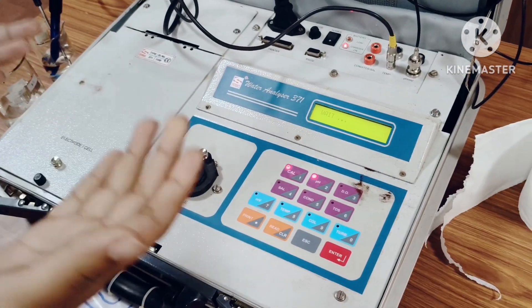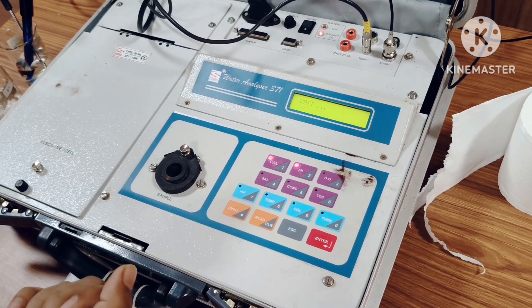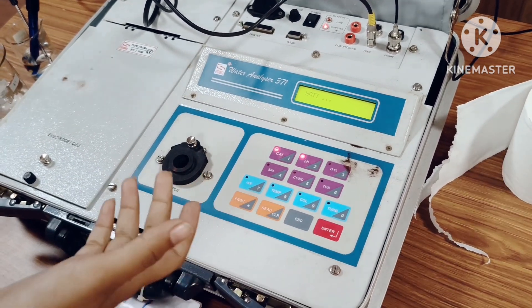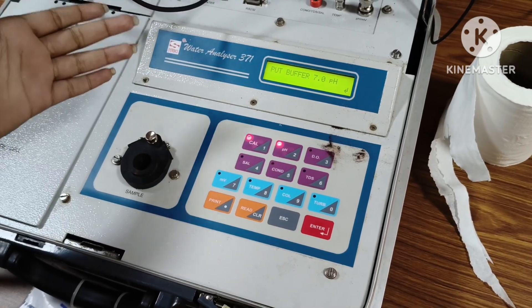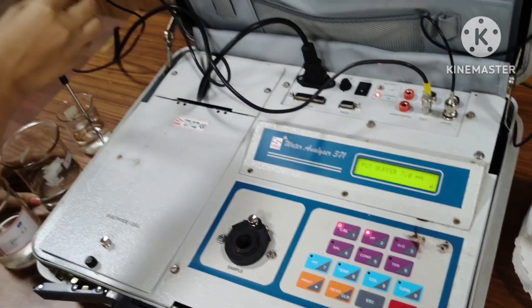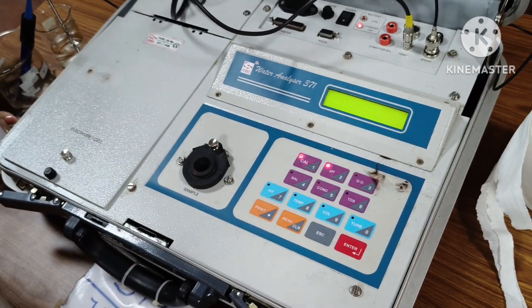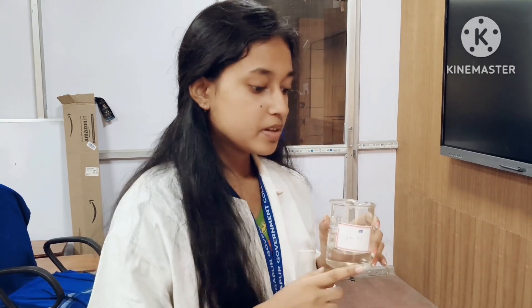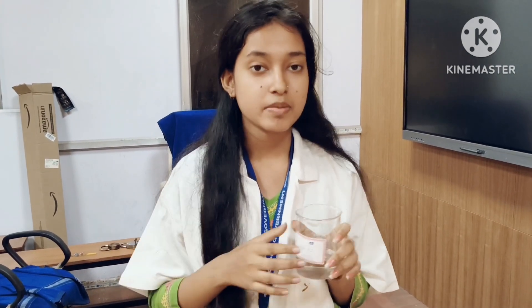We have to wait — it takes some time. We follow the instructions as displayed. Here we can put the pH electrode into the pH 7 solution and then press enter. This is a pH 9.2 solution, which we need later. To make it, we take 100 ml of water and a pH 9.2 tablet and dissolve it.